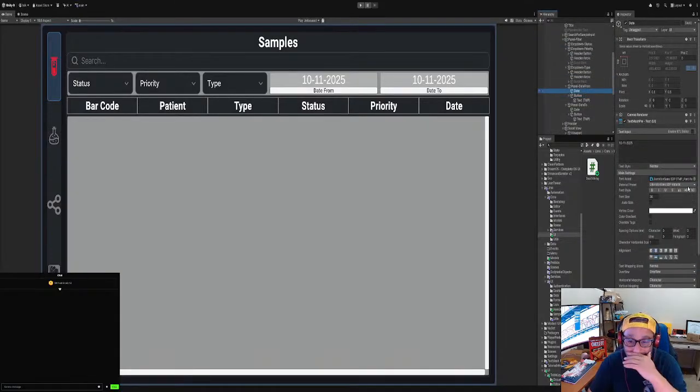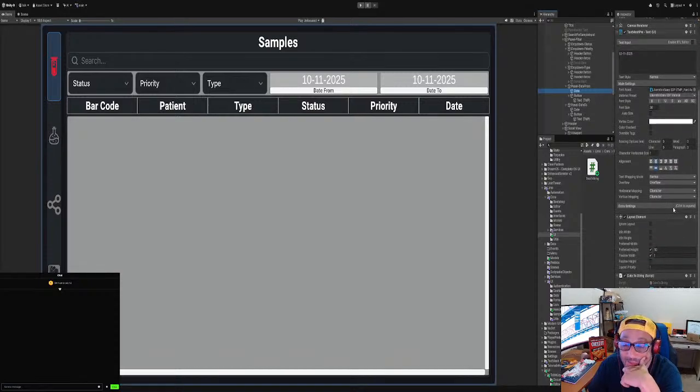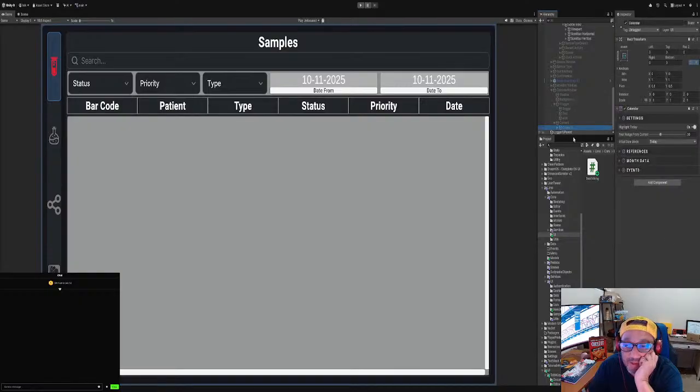All right. So can we do it here? Let's see. We actually could do it from the calendar, right? From the calendar, right? So what we're gonna do is we got an event, right? We set the string first, right?